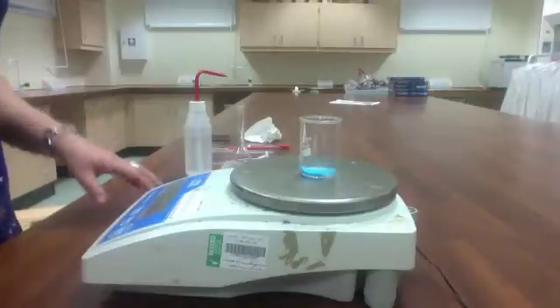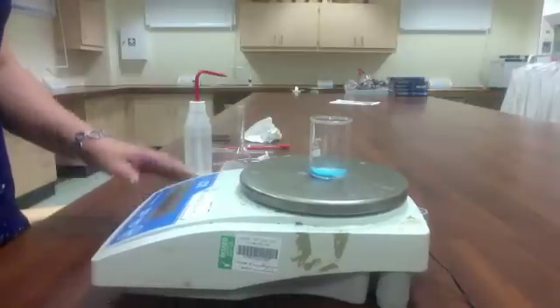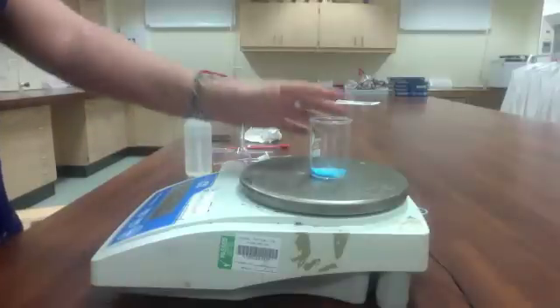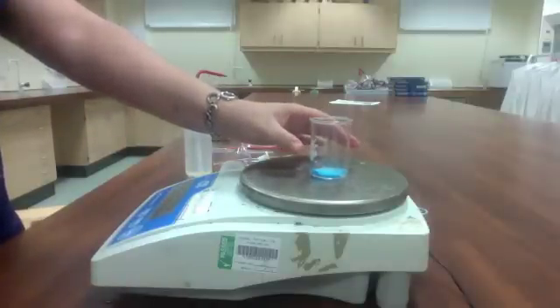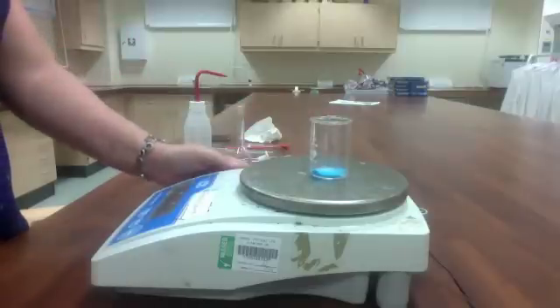Taking a look at steps to make a solution. Once you've calculated the mass of solid that you need, we'll weigh it out on the balance in a clean and dry beaker.